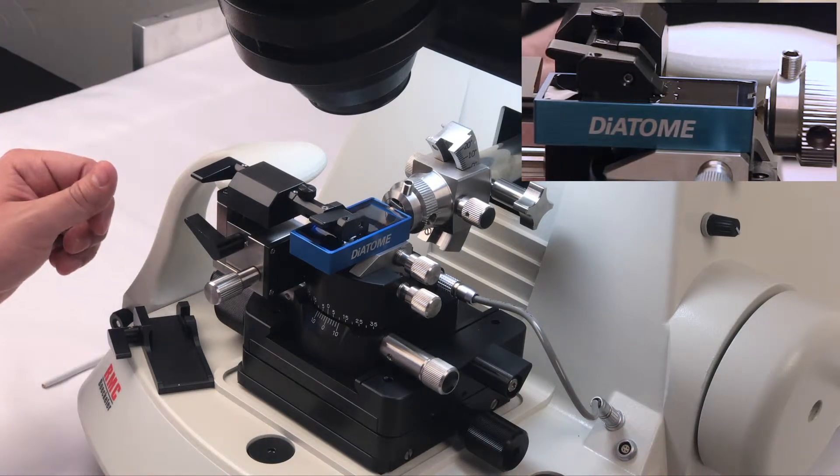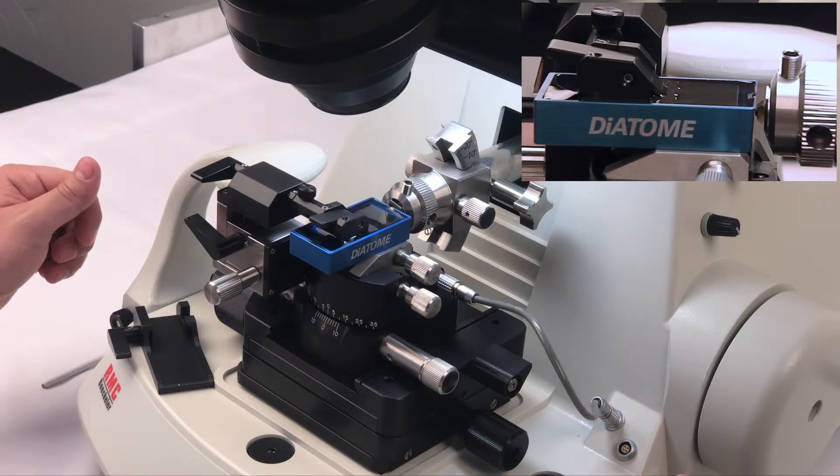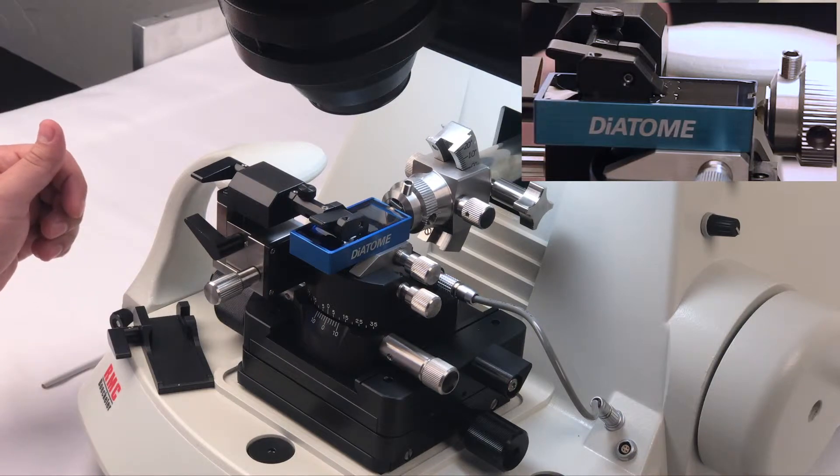Now we can get down to sectioning. So we've already done the approach. It's maybe about 300 nanometers away from the block, so we'll just start sectioning now.